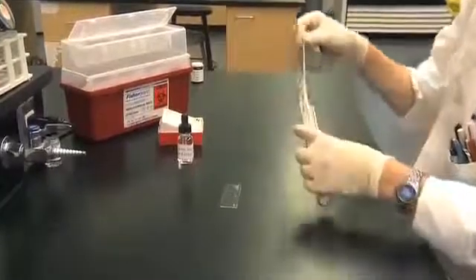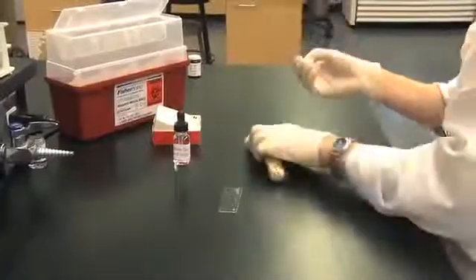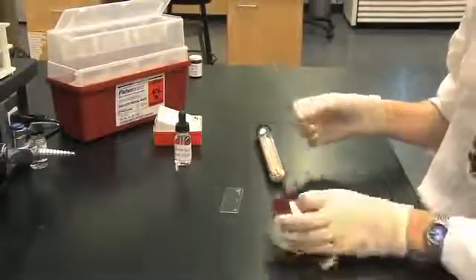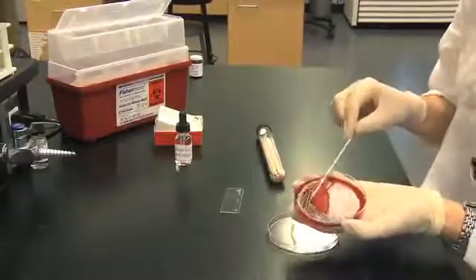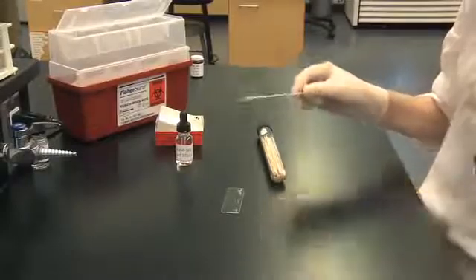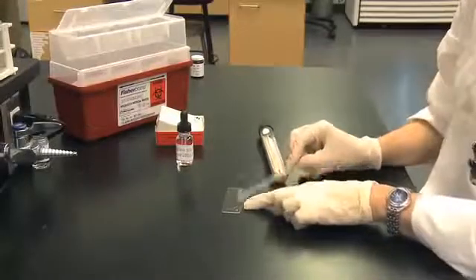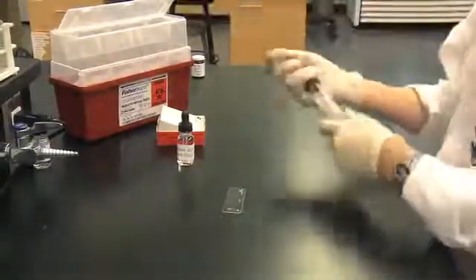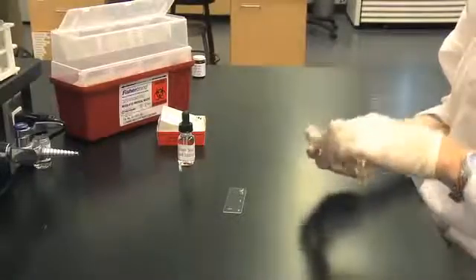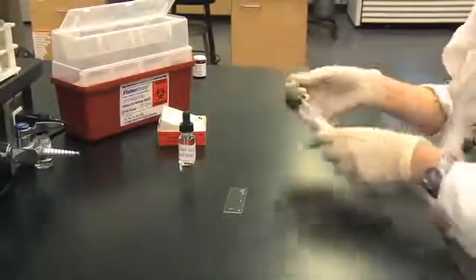Transfer a portion of a single colony to a clean glass slide using a sterile wooden applicator stick. Take care not to transfer agar from a blood plate, as the blood will cause a false positive reaction.